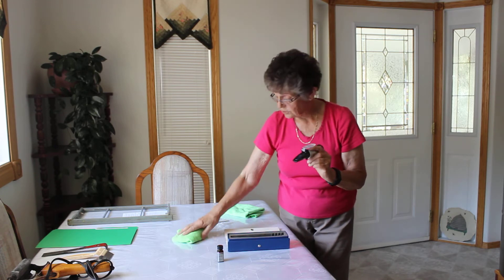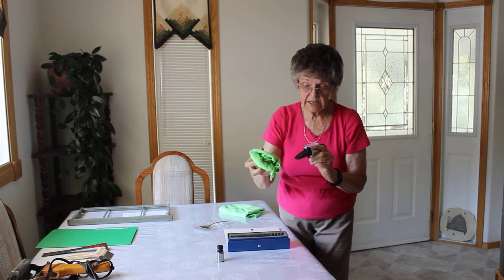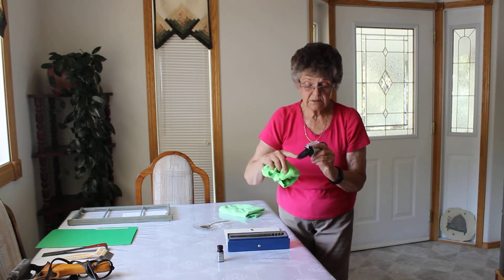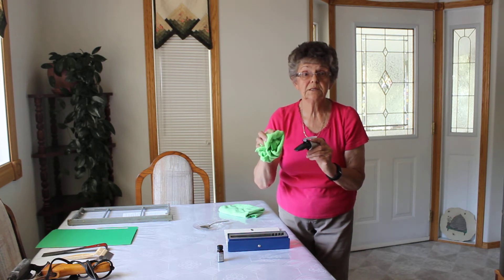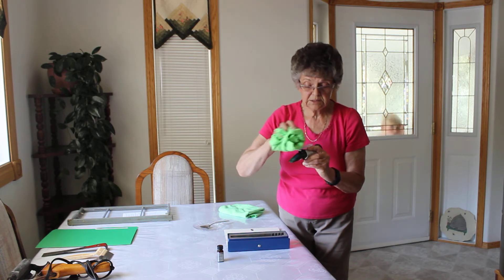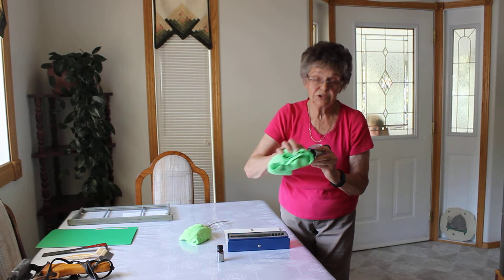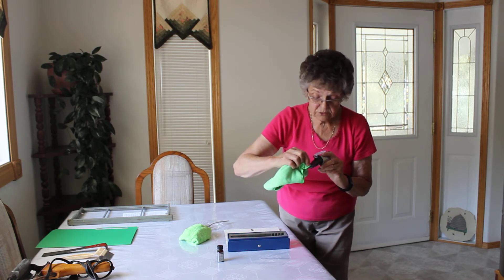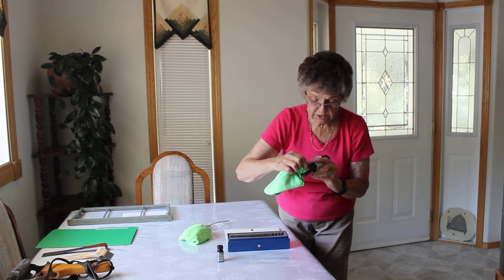What you do then is take a damp cloth and clean all of that off. It has to be a very soft cloth — you do not want to scratch anything here. It's very important because it does have an effect on the outcome. Take your soft cloth, then dry that off because you certainly don't want moisture there. There is a little groove here all the way around — make sure that groove is dry as well.